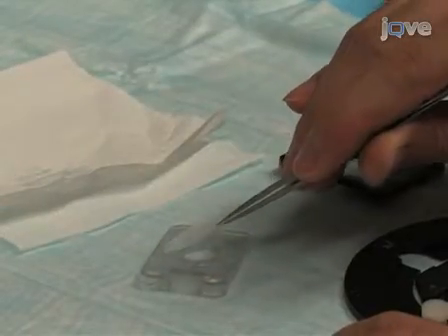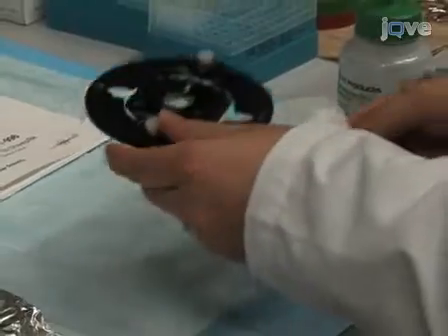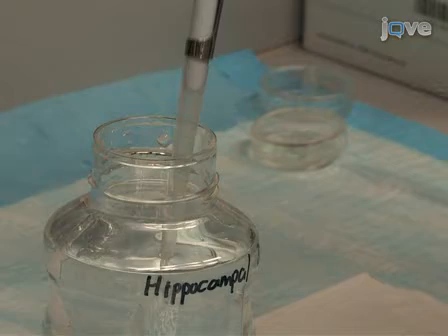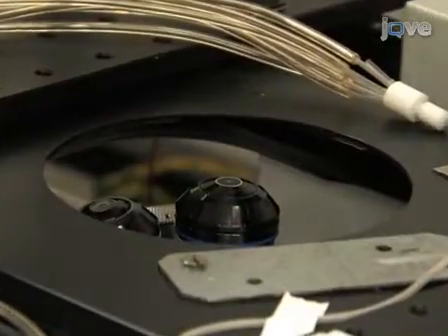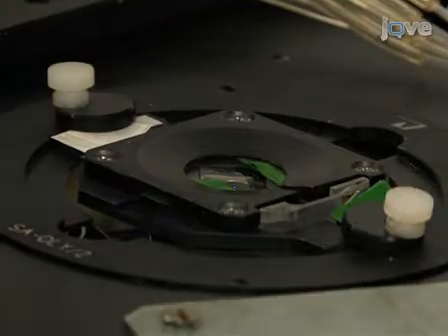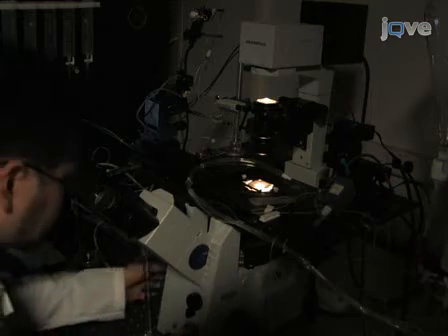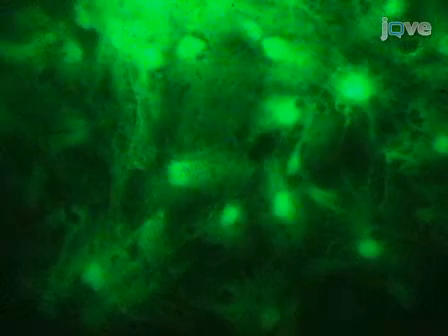Place the coverslip in the chamber. Clean the other side of the coverslip with lens cleaning liquid and add 200 microliters of hippocampal buffer. Put one small drop of immersion oil on the objective and put the chamber on the stage of the microscope. Look at the cells using transmission light to focus and see how the cells look. Next, illuminate the cells with 488 nanometers from a monochromator and determine if the fluorescent signal of Fluo-4 is uniform and detectable in astrocytes. Use epi and TIRF illumination to measure calcium in the astrocytes.